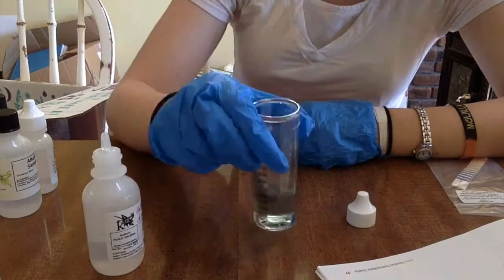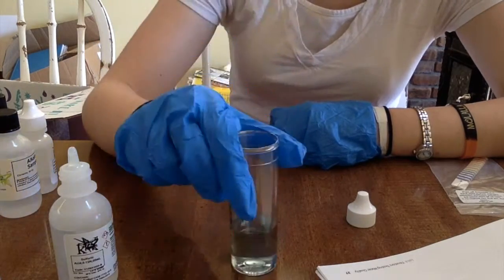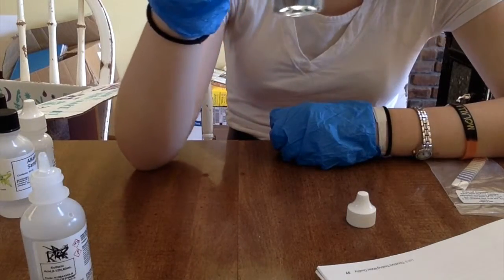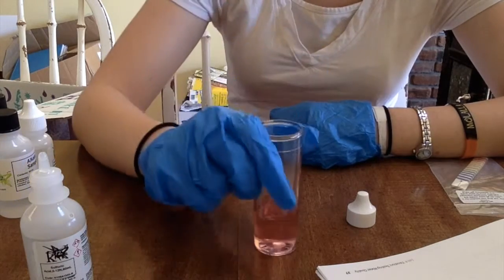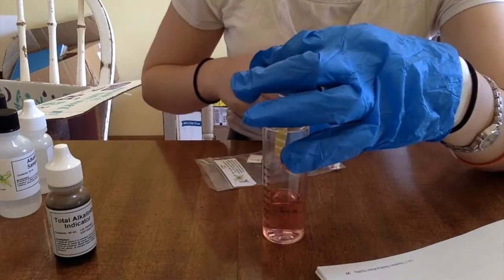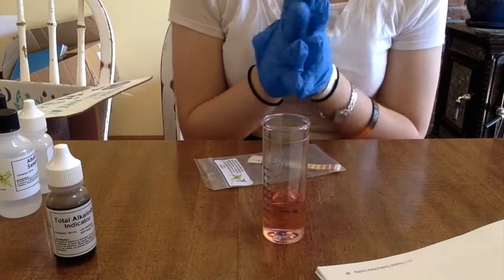Two, three. It is not even close to the red yet. Four, five, six, seven. Eight, nine, ten, eleven, twelve. It's changing a little bit, it almost looks kind of clear right now. Thirteen, fourteen, fifteen, sixteen, seventeen, eighteen. Nineteen, twenty, twenty-one, twenty-two, twenty-three, twenty-four, twenty-five, twenty-six, twenty-seven. At the very top it's turning pink. There we go. That's a good color right there. Perfect. So that was twenty-seven. Use the pH paper to check that the sample is now at 4.5. That is a lot lighter — it's close to yellow, it is yellow, right at between three and four, or right at four. I think it's four point five. Experiment part one complete.